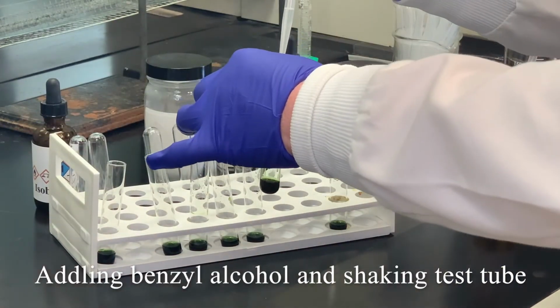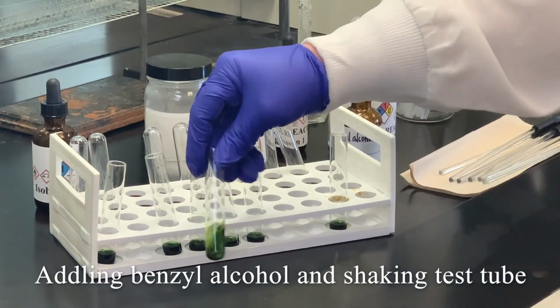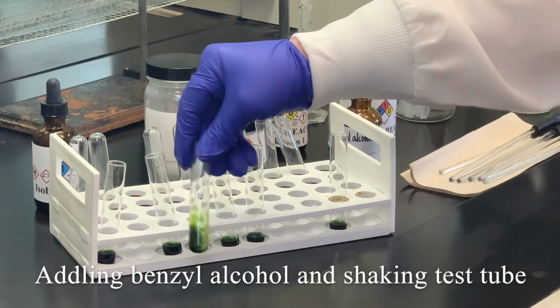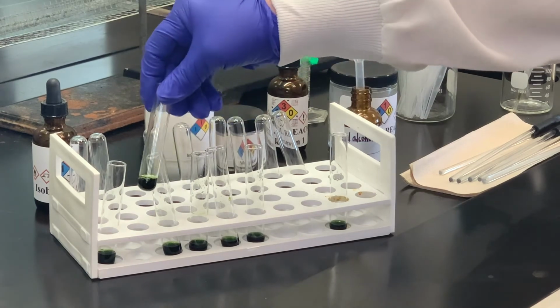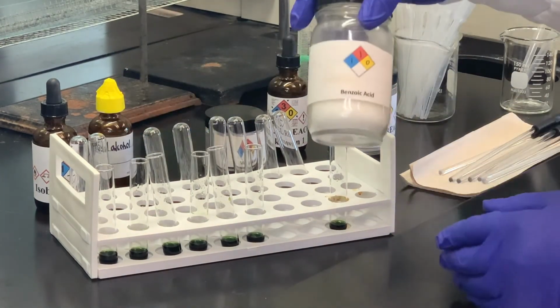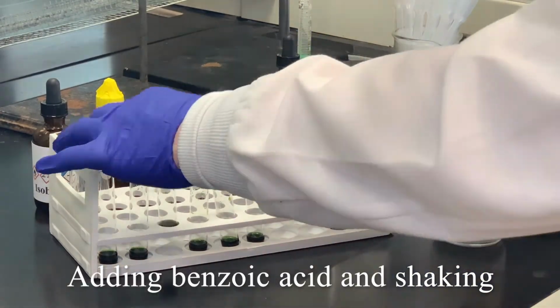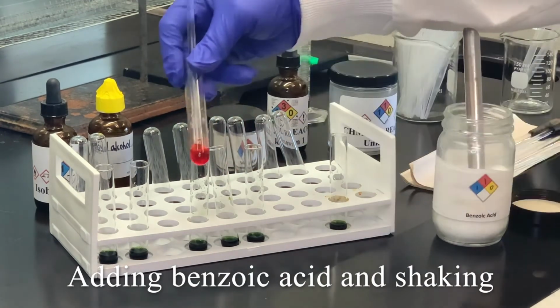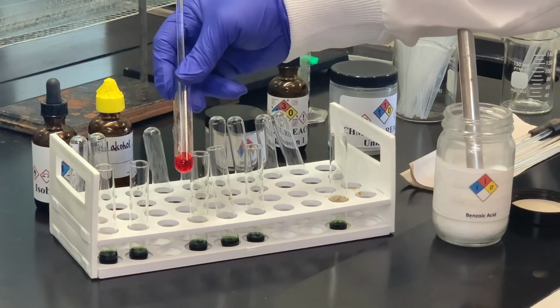Add a couple of drops. Shake and see if we see anything happen there. And I don't notice any change in the solution, so as we would expect, most likely an alcohol there. The next substance is benzoic acid. And you can certainly tell there's a change in the color, so it looks fairly red, pinkish red to me.